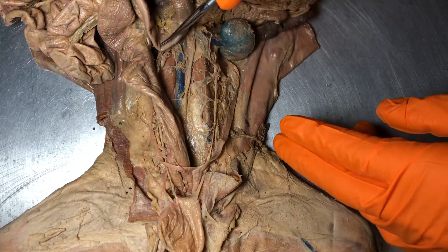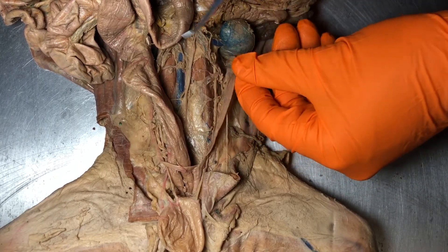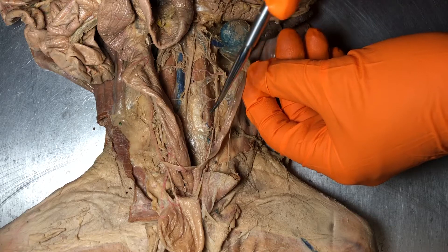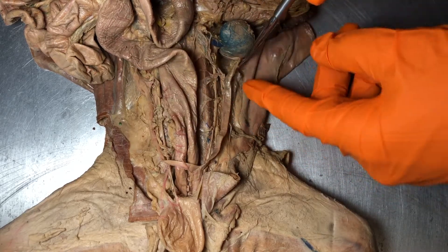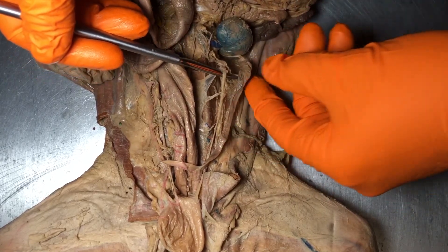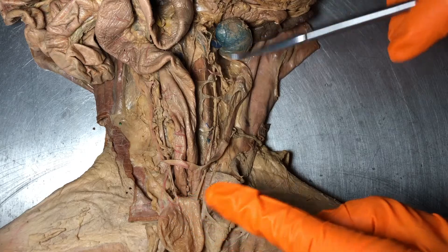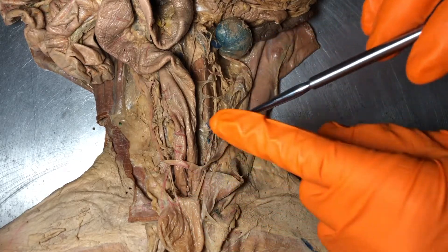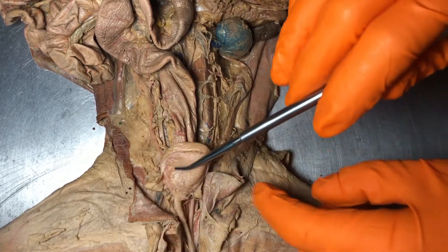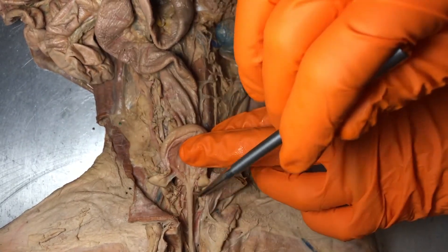This becomes much more important in the reproductive system. These tubes right here are actually part of the cat's uterus, and we will come back to this in the reproductive chapter. Students mix these up all the time, and I get that, except we have to make sure we remember what body system we're in and what that passageway connects to. Always make sure you're looking around when you're given a passageway — see what it connects to.